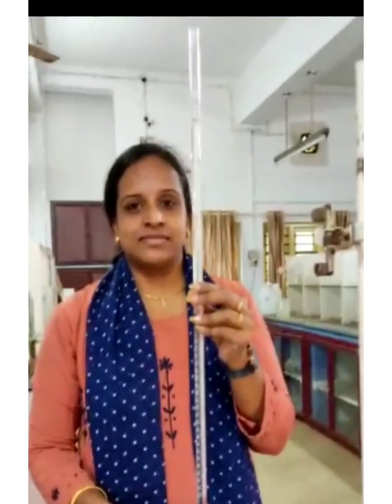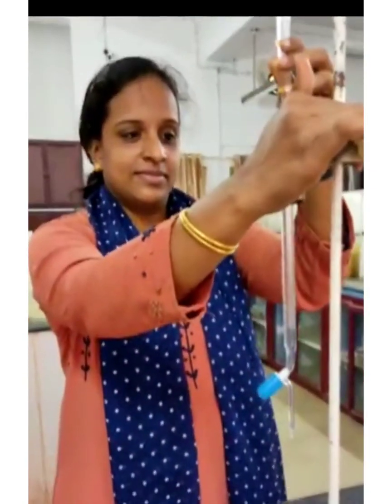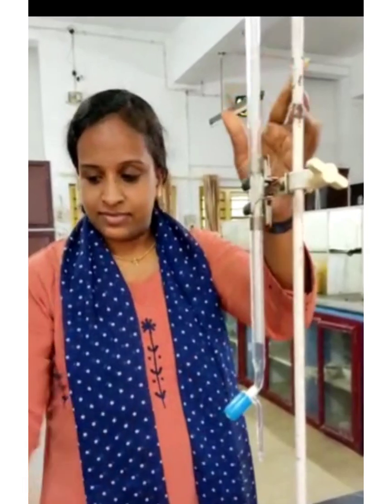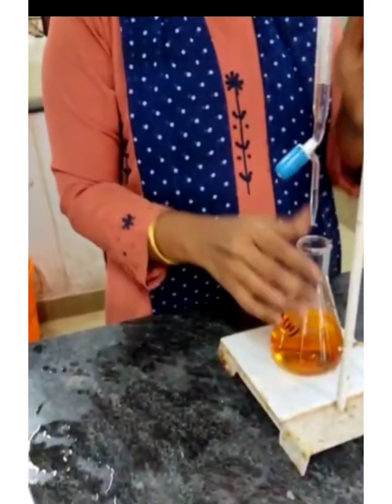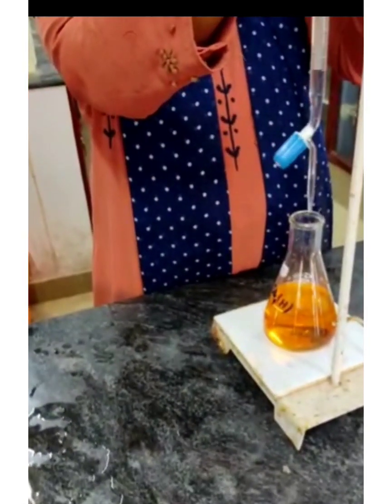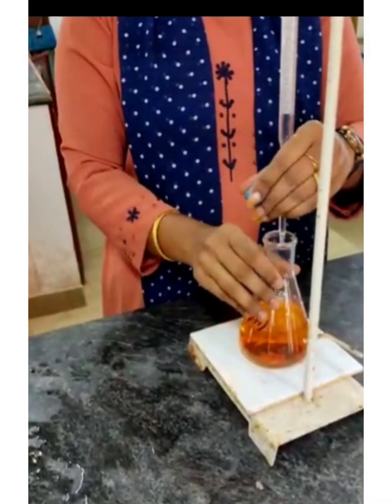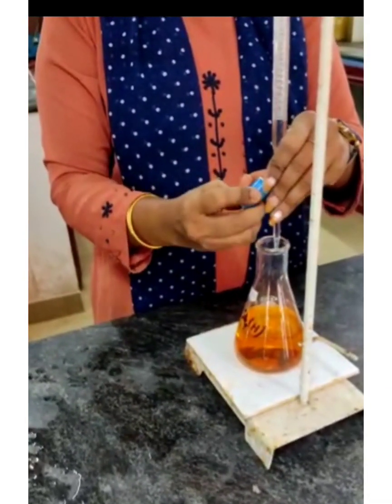The burette is filled with 0.025 normal sodium thiosulfate solution. Titrate the solution against sodium thiosulfate to get a pale straw yellow color.